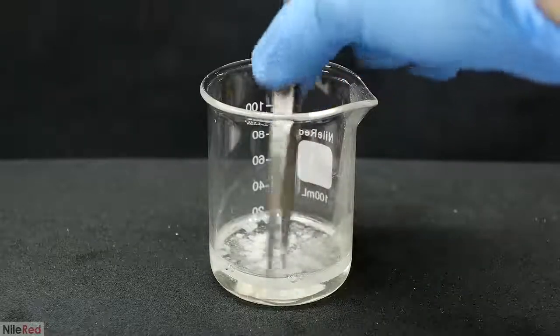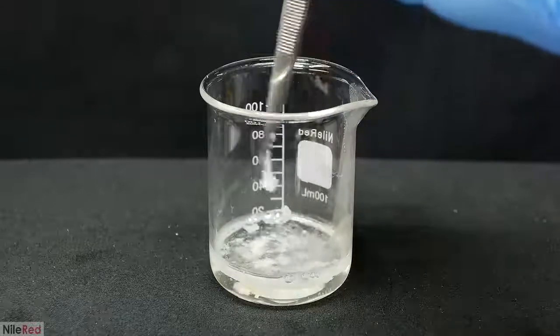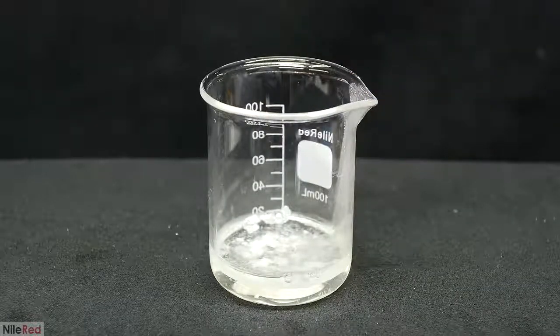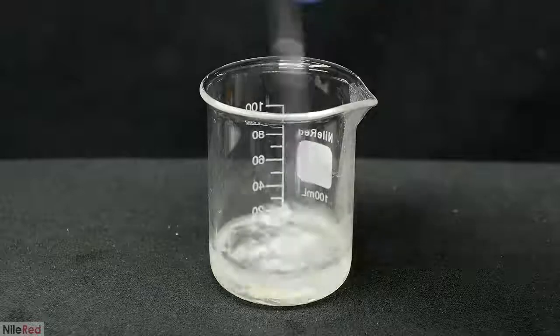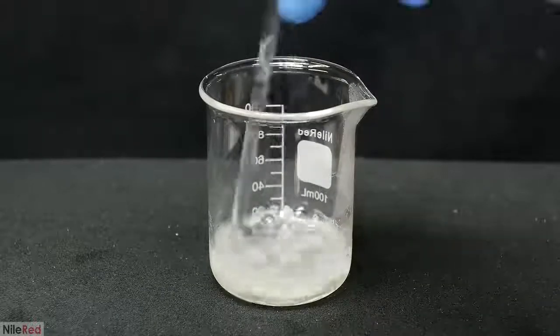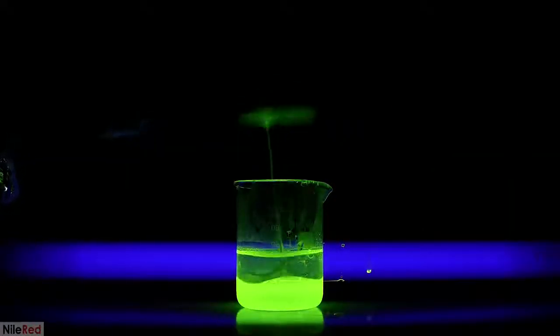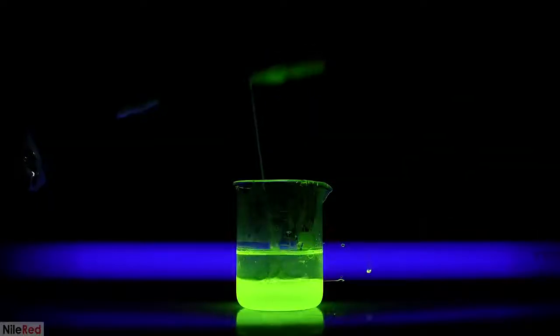In the other runs, when I pull it out using tweezers, it's an extremely thin layer and it makes it look like I'm pulling out a whole bunch of nylon. However, in reality, there's actually only a very small amount. For the last run, I used a lot more of each, and I thought it would take a while, so I used the drill as well.